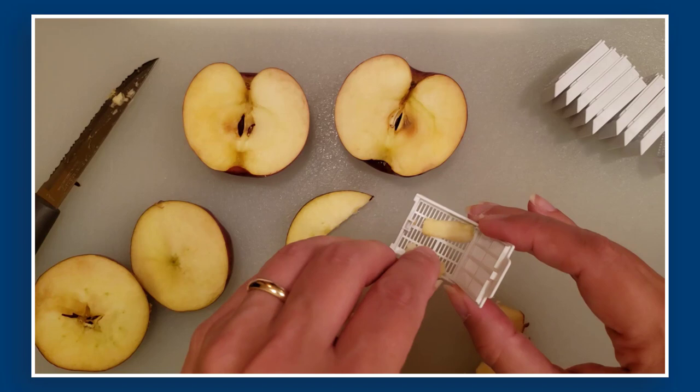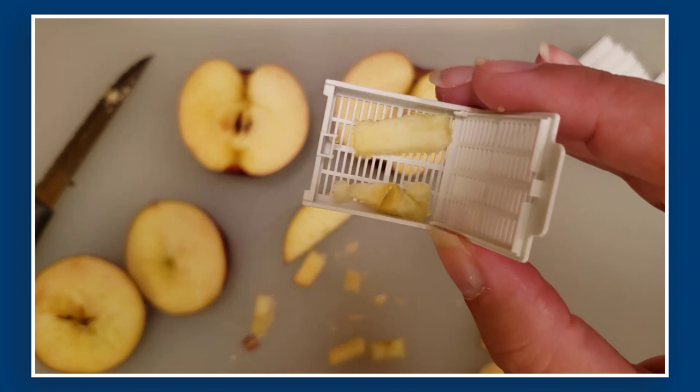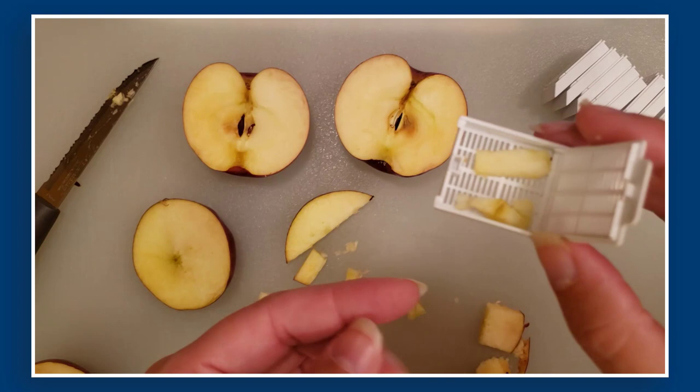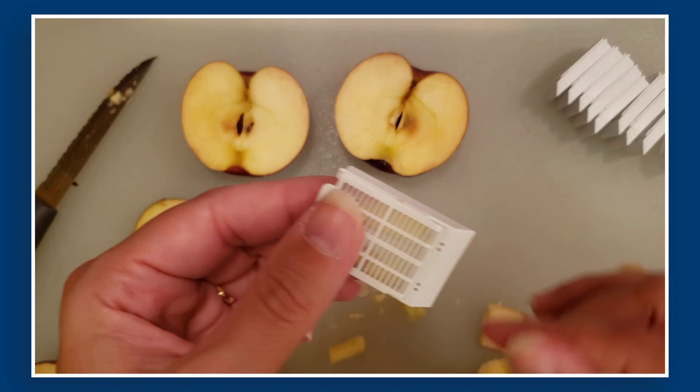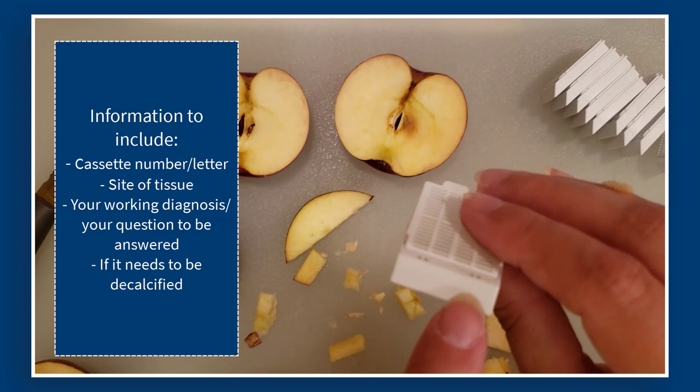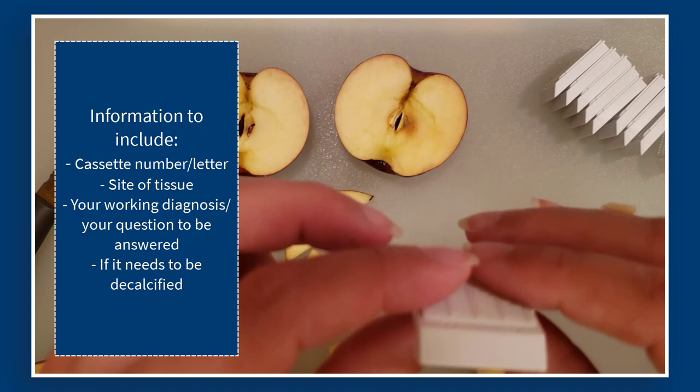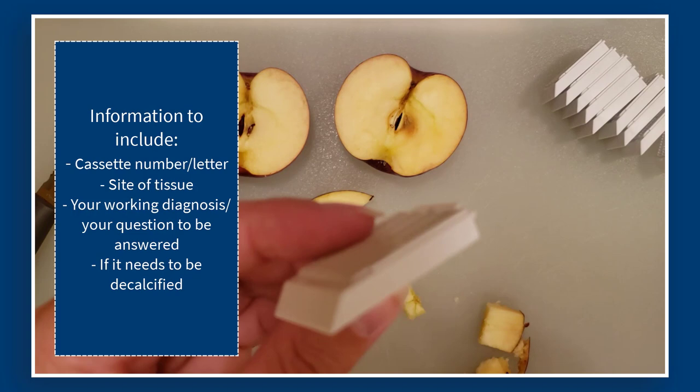One of the key things about pathology is it's all about representative sections. This is a nice representative section — it does a good job of encapsulating everything we saw from the original apple. After you've filled the cassette, clip on the lid. Then on the log sheet in your room, write down the printed number showing your table number and then either an A, B, C, D, or E so we can identify the exact cassette for your table. Write down the information listed on the side, go wild, have fun — I look forward to seeing all the amazing pathology you find this year.